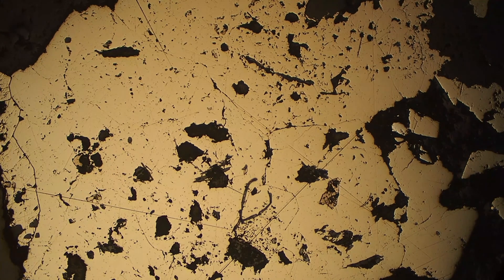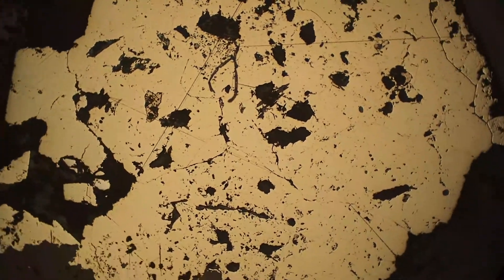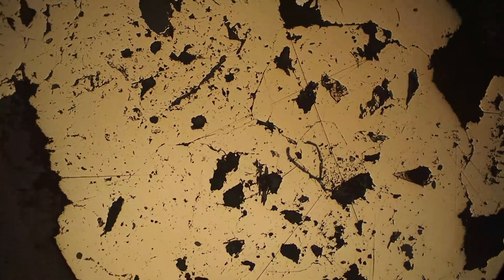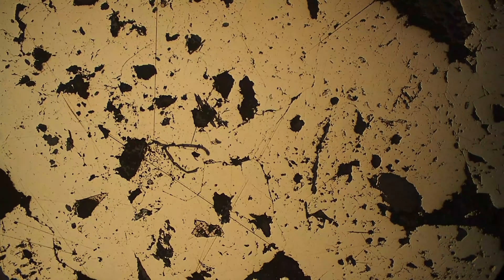This is our last example of pyrite. One thing to bear in mind going forward is these are pretty pristine samples, so some of them are showing nice cubes. Mostly it's more jagged edges — not perfect crystal form — but pyrite can have a lot of different crystal forms, and that's a subject for another video.